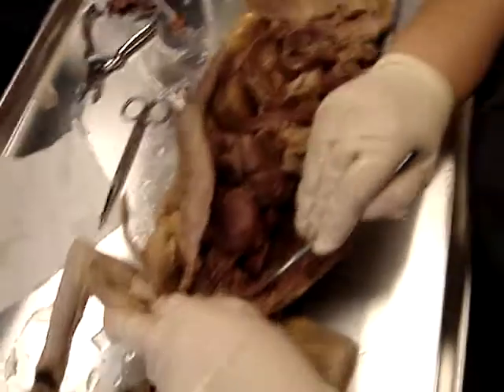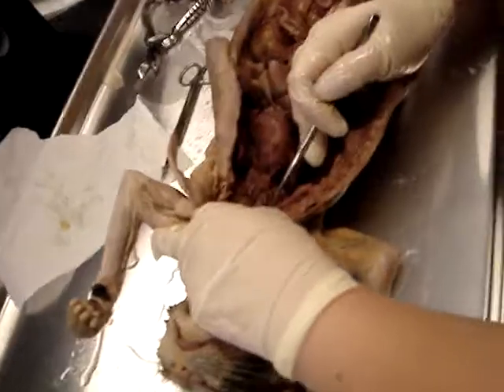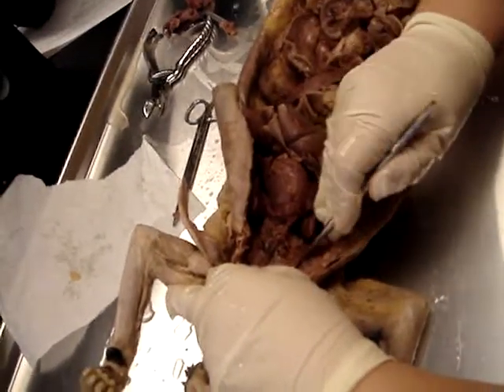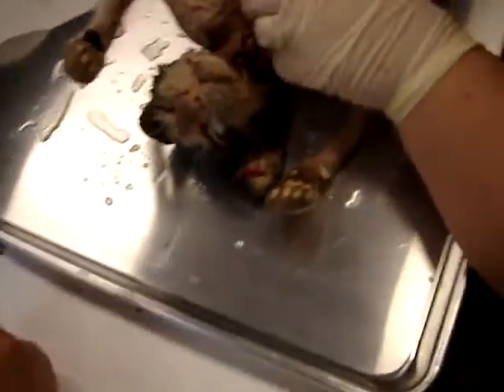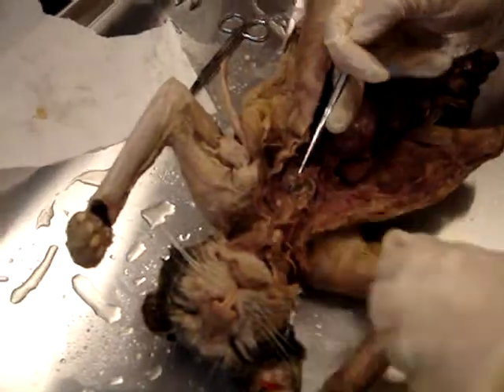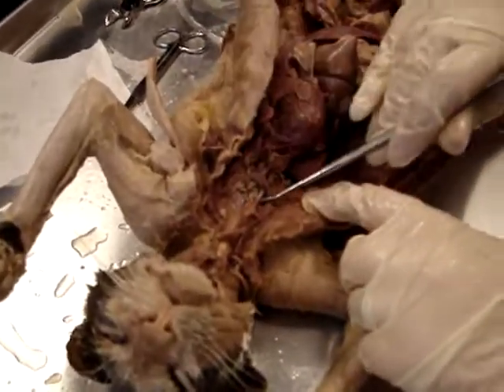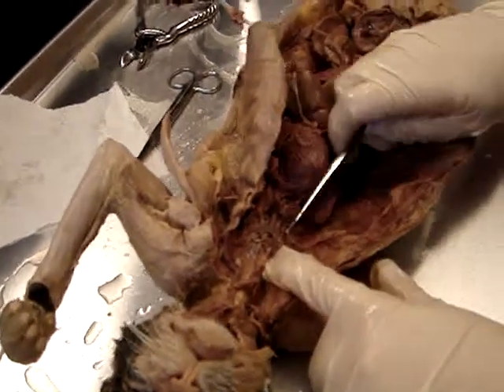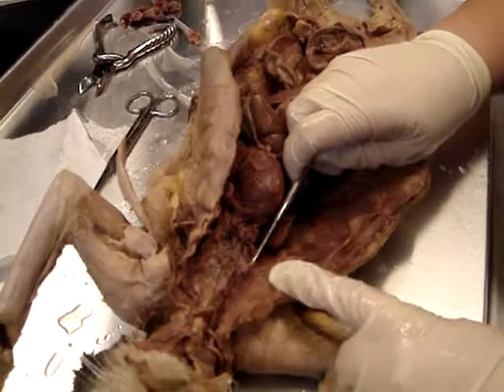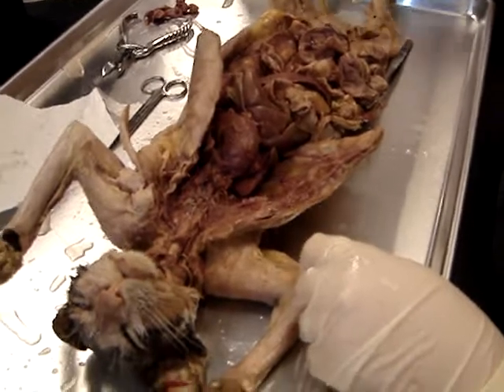So 1, 2, 3. And so the one that's farthest to the right side is the right subclavian artery. And then we have our common carotid. So this would be the right common carotid, and then this would be the left common carotid. And they both branch off of that one? Yeah, we couldn't see the middle one. Really. Okay, so left common carotid, right common carotid, and then right subclavian artery. So that's right below. Okay, so look at my drawing, how it shows that there are 3 things that branch off of the brachiocephalic artery.